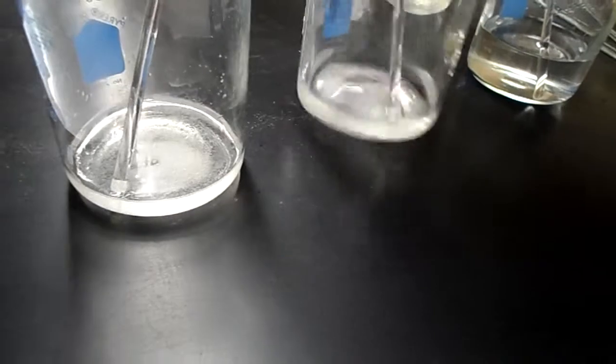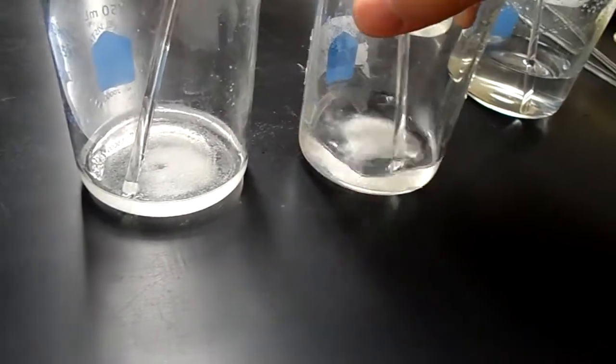Okay, so I am going to let this sit for a little bit longer while I move on, but right now it's looking like the sugar is dissolving better than the salt, but I will come back to this and make sure. So I'm going to move on to my second step.